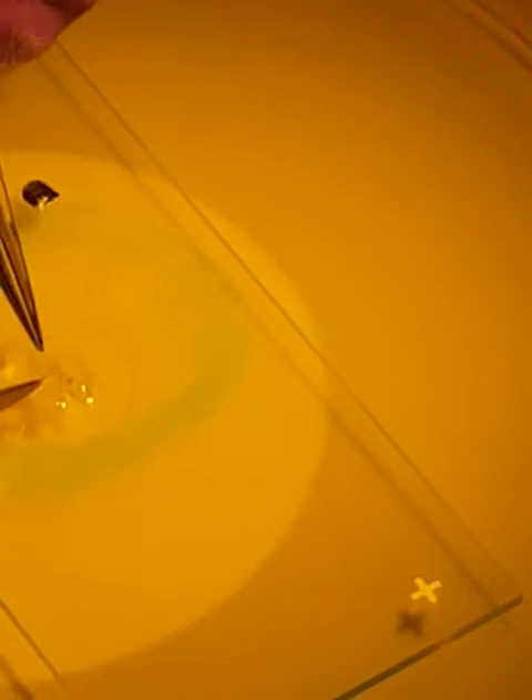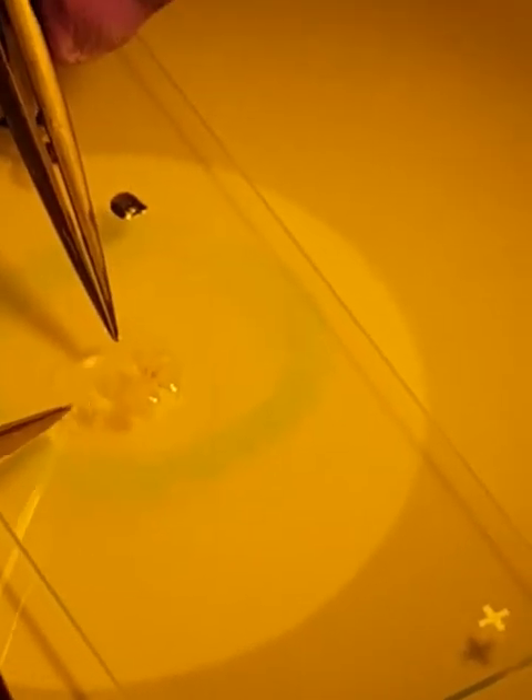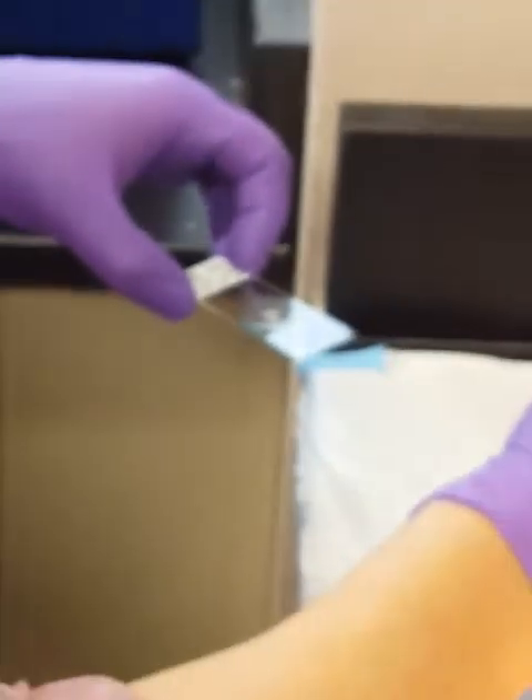Sometimes it's way more difficult — you have to remove the water otherwise it's going to be impossible. But your flat mount is there. Now with the PBS you have to wash it, so put one drop of your wash before it gets dry.